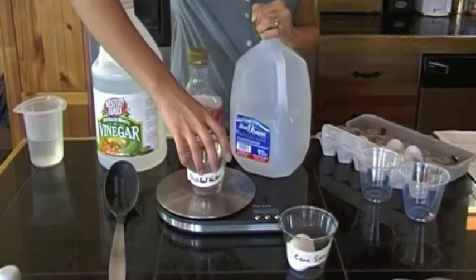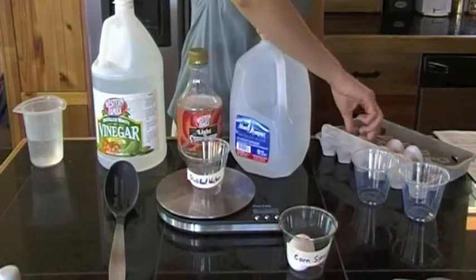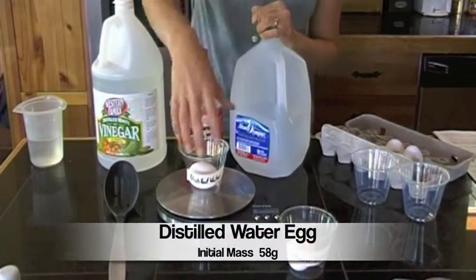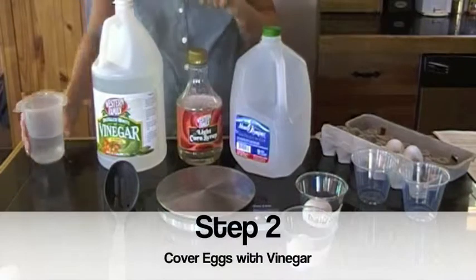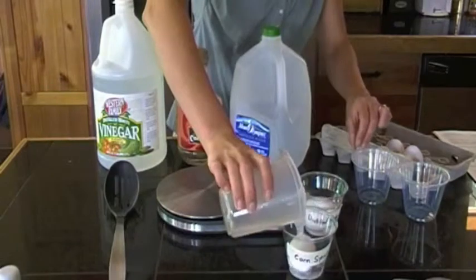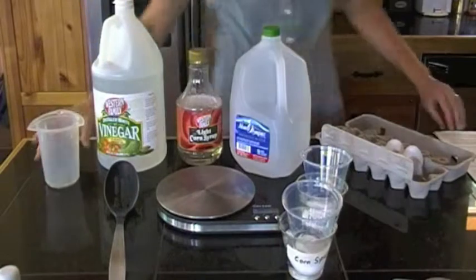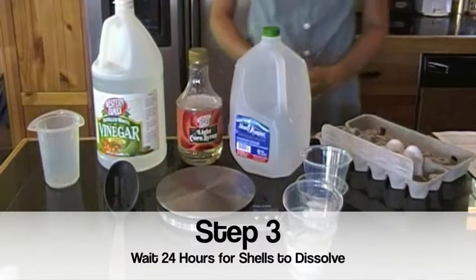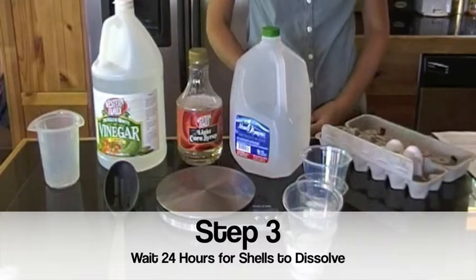Let's repeat again with our second container, and this container is labeled distilled water. Press the 0. Add your egg. And this egg is going to weigh 58 grams. All that is left is to add your vinegar, and cover it with another container so that it remains submerged. Now we will wait 24 hours for the acidic vinegar to dissolve the basic eggshell, exposing the underlying membranes. This way we can observe osmosis in action.